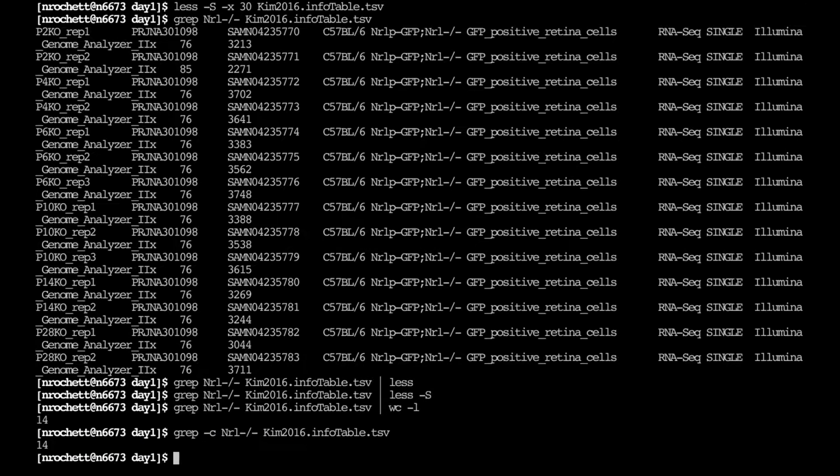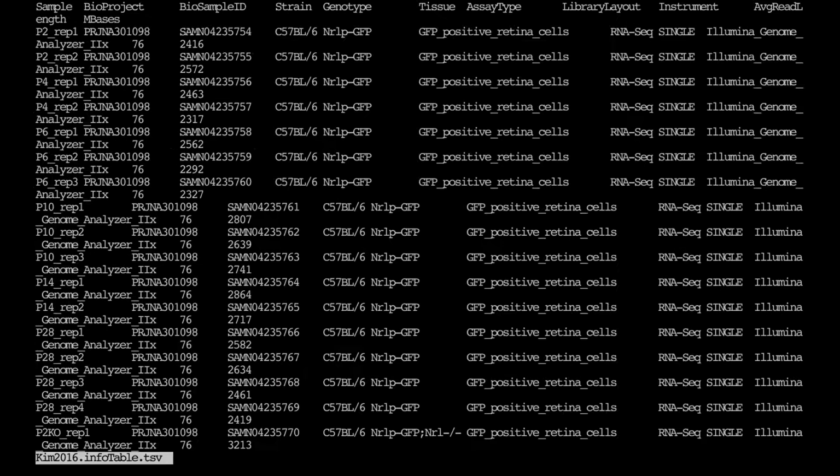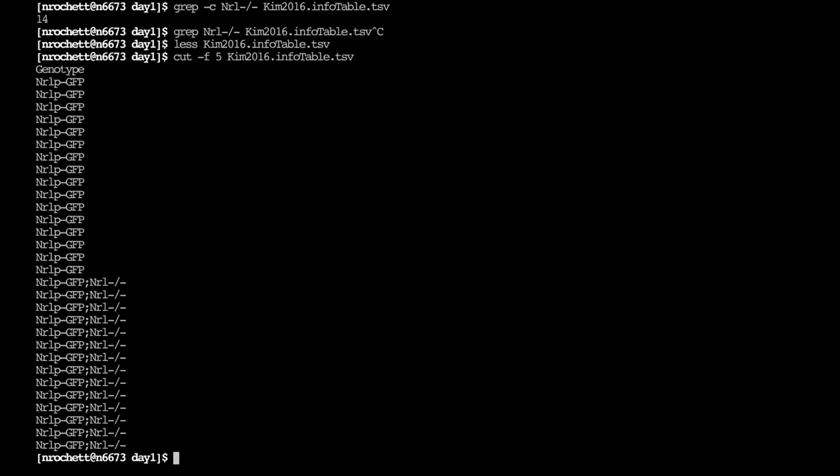One way that's very useful to know is actually doing a table of what's in a specific column of a file. So here, what we're interested in is the genotype column. So that's the 5th column. And to extract the 5th column, we can use the cut command, and then -f5. The f is for field, and that's for column. And we want column number 5. And that way we can just extract the 5th column from the TSV table.